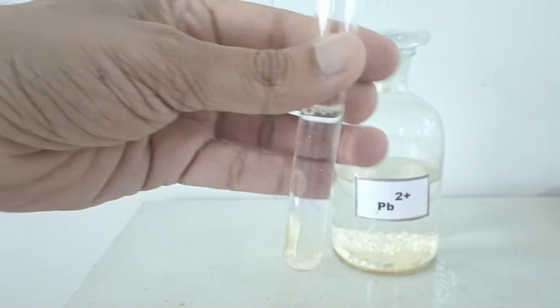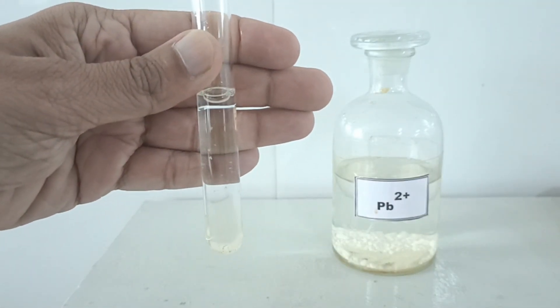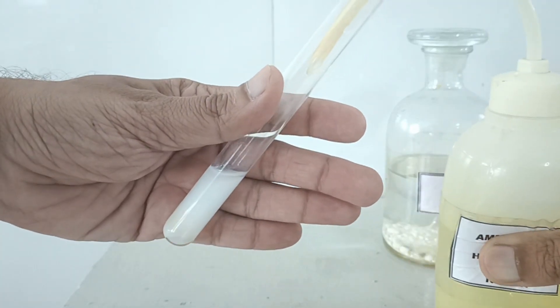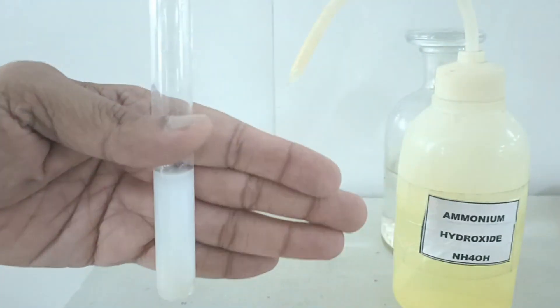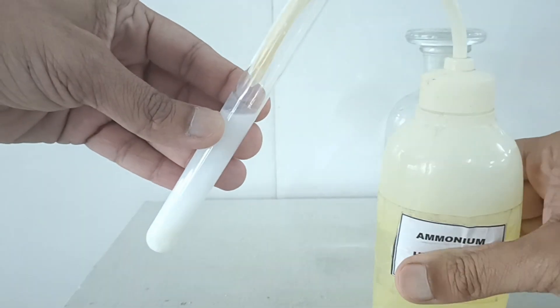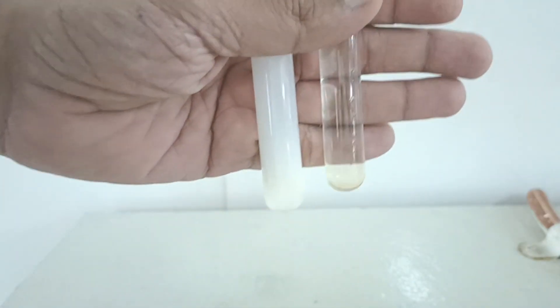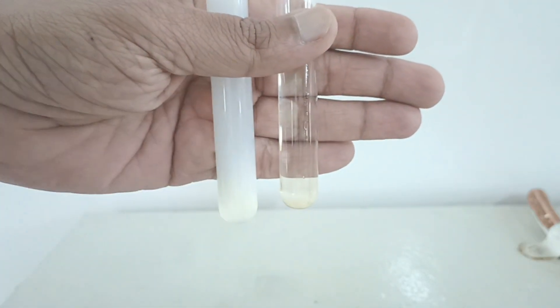On adding excess amount of sodium hydroxide solution, the white colored precipitates disappear. In another test tube containing lead chloride solution, let's add about 1 ml of ammonium hydroxide solution. White colored precipitates are formed immediately. On adding excess amount of NH4OH solution, the white precipitate remains without getting dissolved. Here we can compare: this one with excess NaOH, and that one with excess NH4OH.